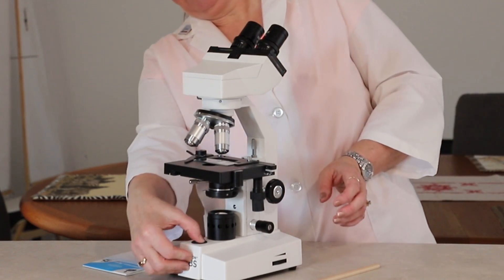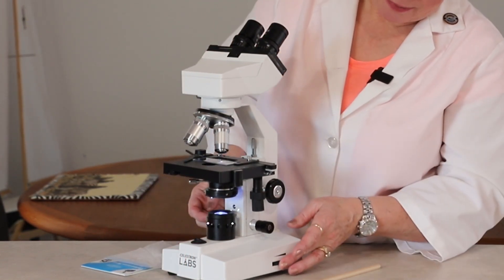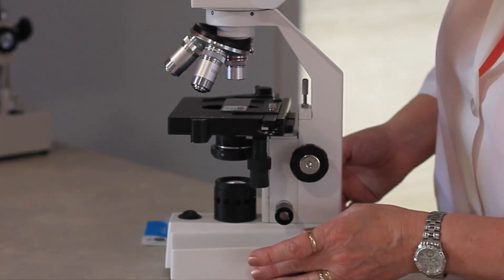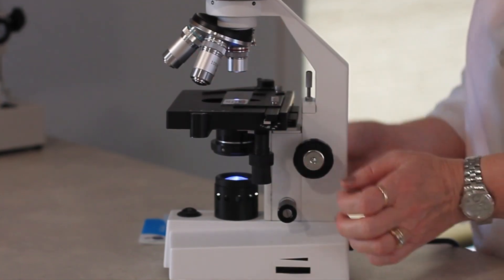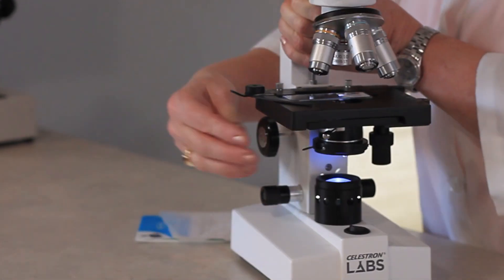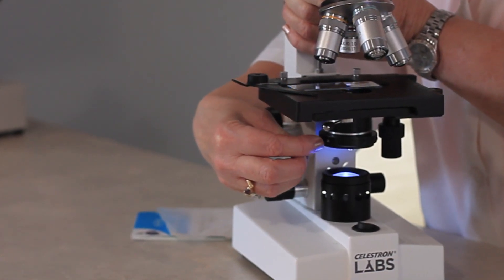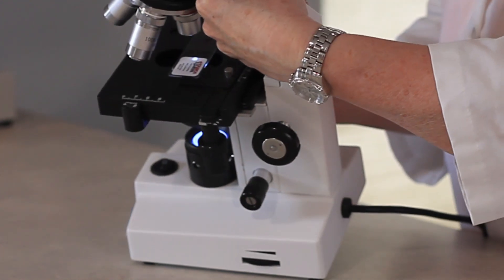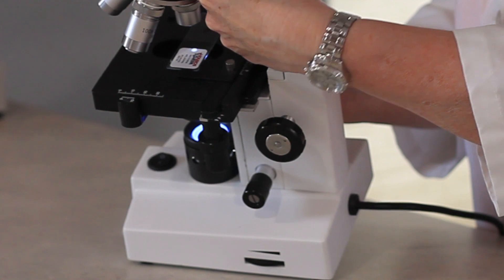We have our light source here. This one is adjustable, so I can turn the light way down or way up. And as I'm looking at the specimen, I can also use the diaphragm — which is this little lever right here — to increase or decrease the light that is showing through as I'm examining the specimen.